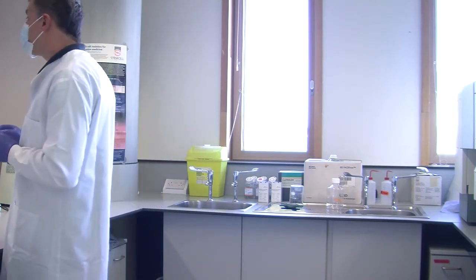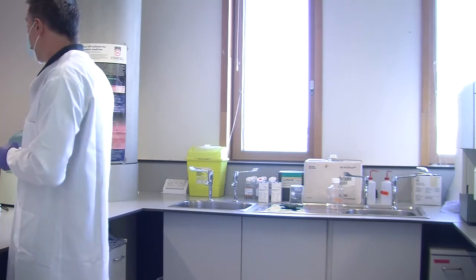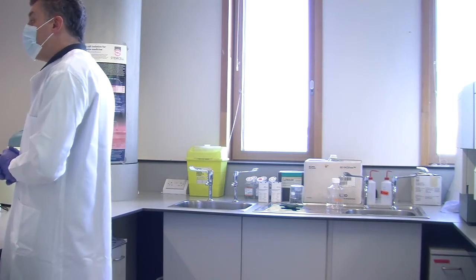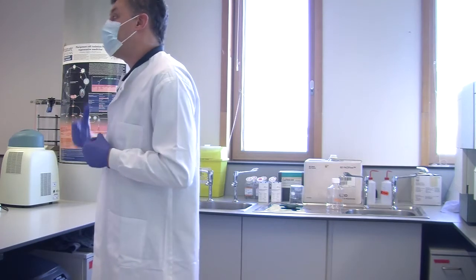So fixing can stop some antibodies recognising your markers. It's one of these things that when you're designing your experiment, fixing versus non-fixing is like the antibody choice. There are all sorts of different stages that sometimes you do, sometimes you don't. And there are different fixatives, and there are different permeabilization agents.